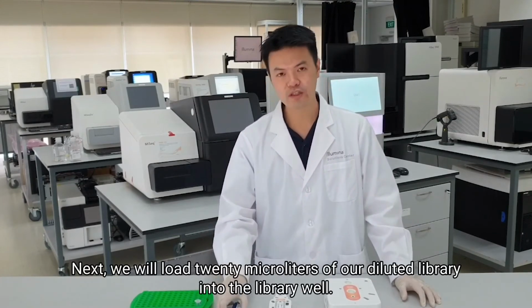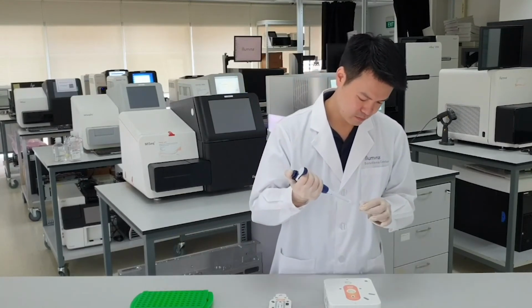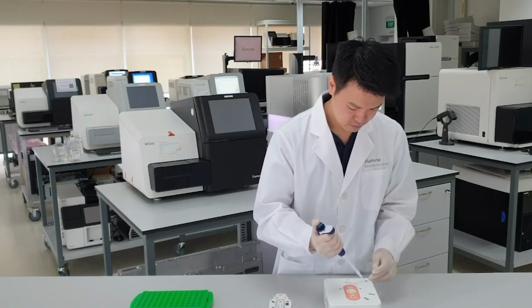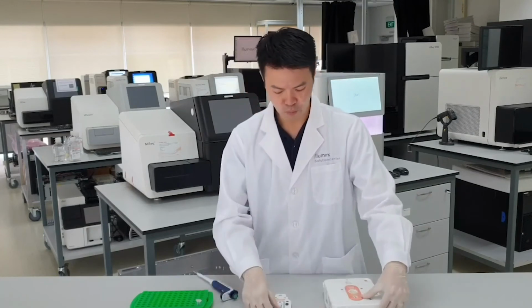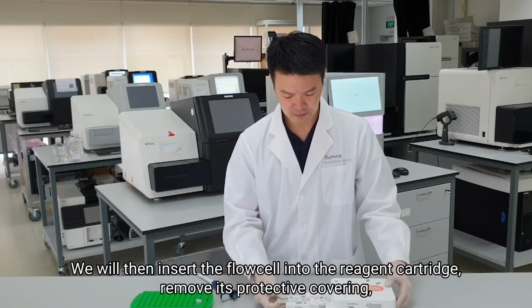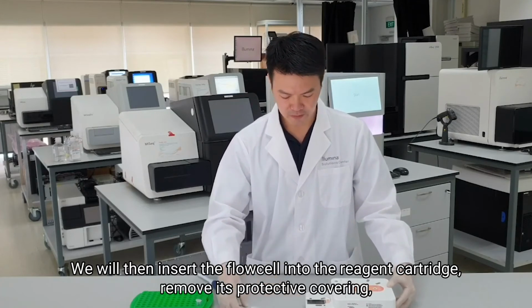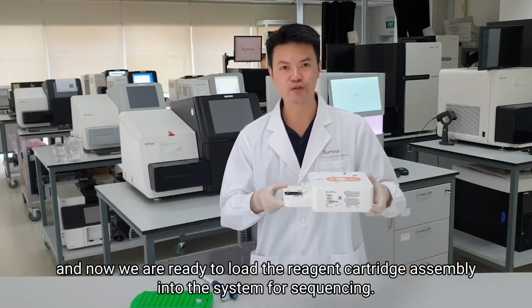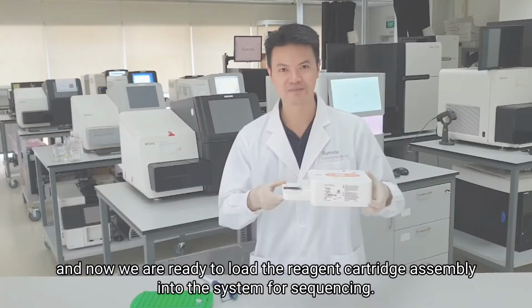Next, we will load 20 microliters of our diluted library into the library well. We will then insert the flow cell into the reagent cartridge, remove its protective covering, and now we are ready to load the reagent cartridge assembly into the system for sequencing.